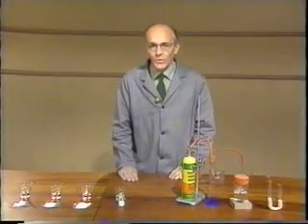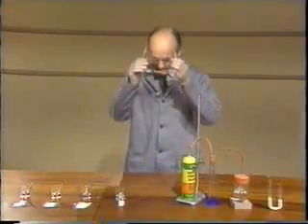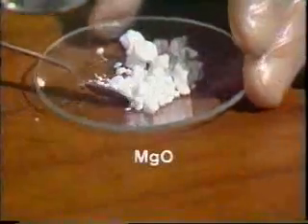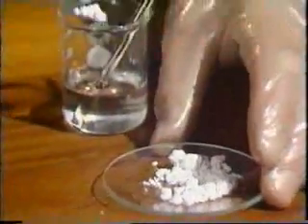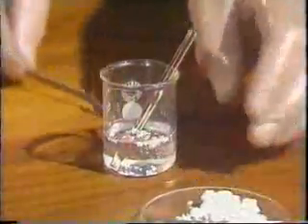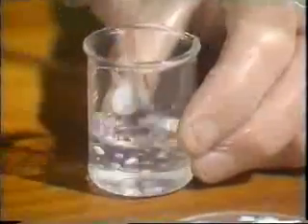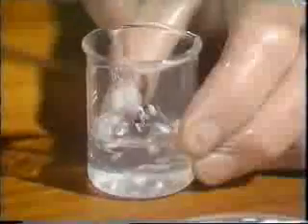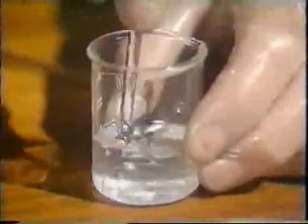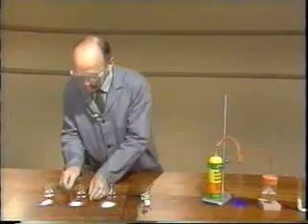Now let's see whether these compounds dissolve in hexane. First, magnesium oxide. And I stir this. There doesn't seem to be any sign of the magnesium oxide dissolving. Now let's try aluminium oxide.